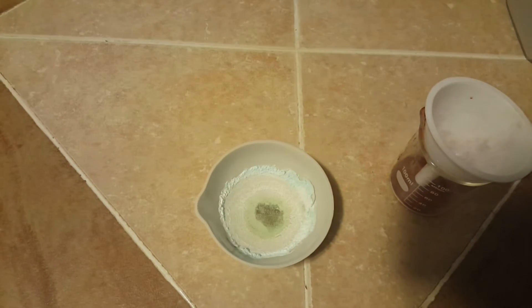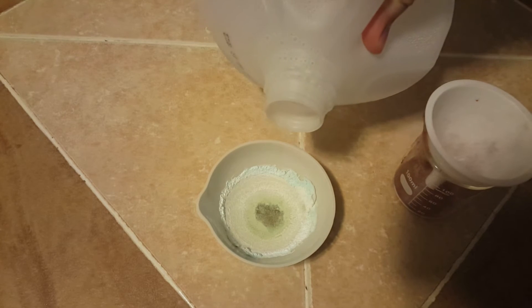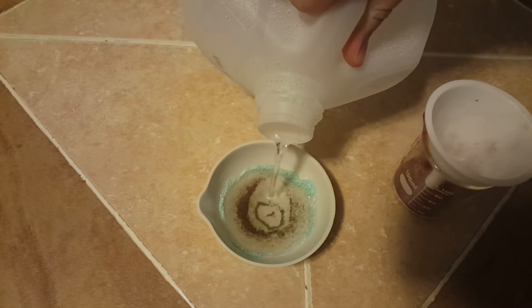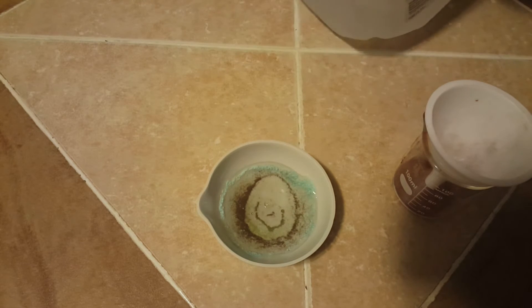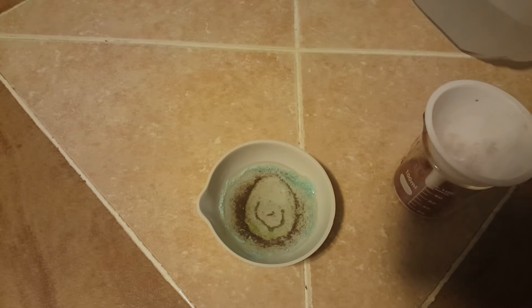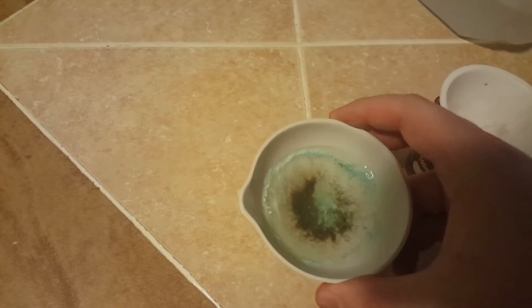However, if you don't have a heat source this is completely possible to do without one — it just takes much longer and you get a much lower yield. What I'm going to do is try to wash some of this salt away, and because Chevreul's salt is insoluble in deionized water I can wash away the other reagents and achieve relatively high purity.